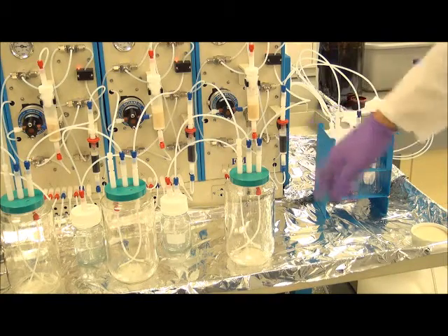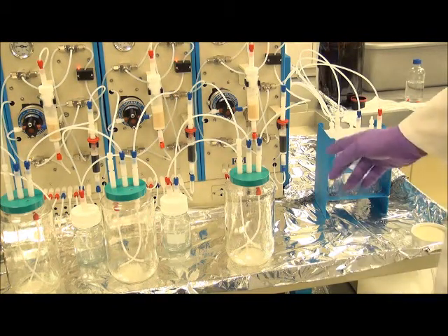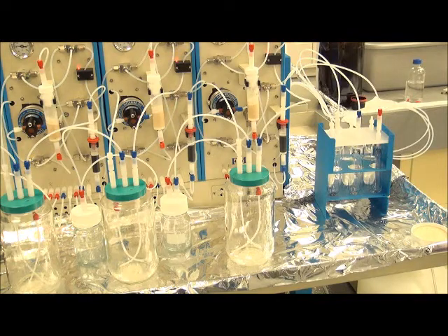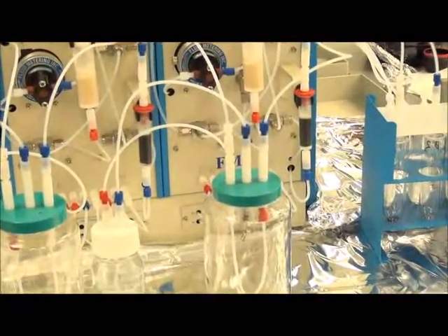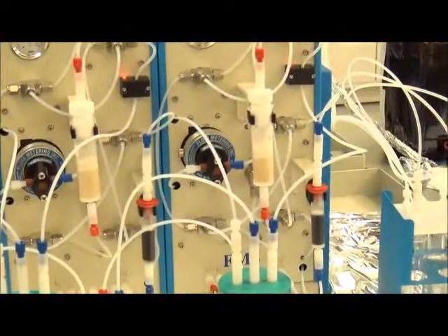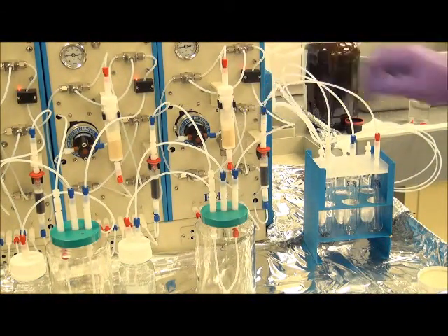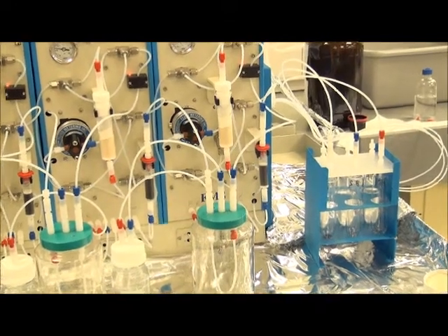As we finish up the pH exchanging with the ammonium hydroxide, once both cartridges are exchanged, it'll then go into a brief nitrogen purge, as it did after loading the sample, to remove all the residual ammonium hydroxide water solution from the cartridges, and then elute them into the basic fraction. So there'll be a brief nitrogen dry of each cartridge, just 1 minute each side, and then it will elute. And now the other cartridge will nitrogen dry for 1 minute as well. And now it's beginning the elution of the cartridges.